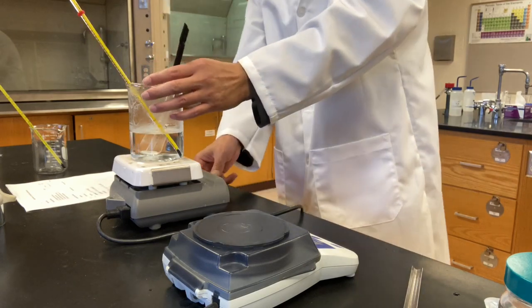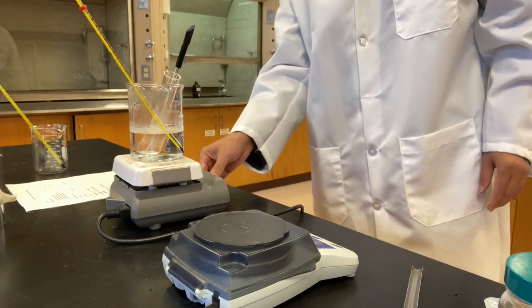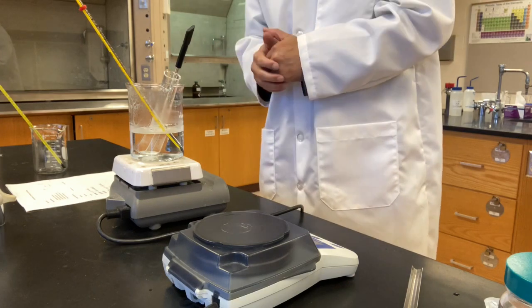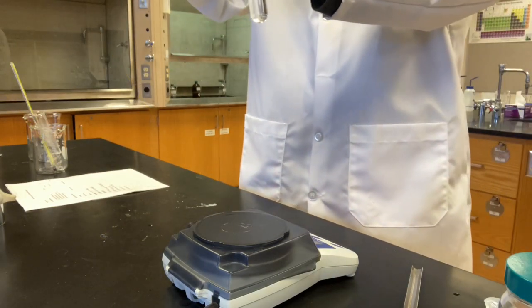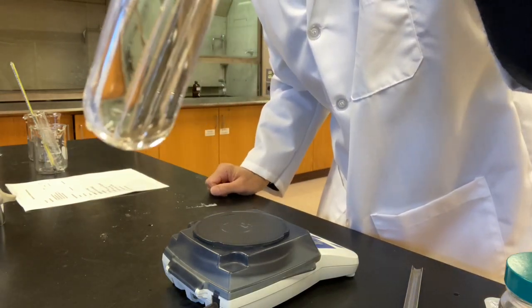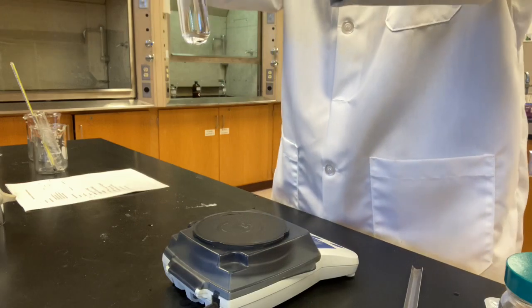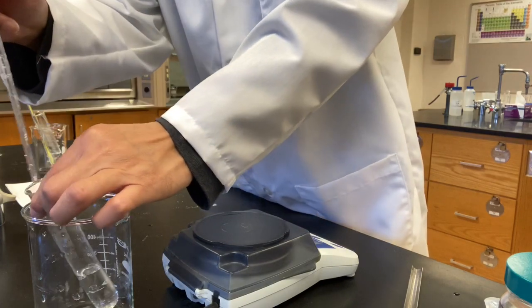Okay, I'm going to increase the heating. Make the water bath at higher temperature, but do not let it exceed 60 degrees Celsius. When temperature is too high, it's hard for you to cool it down later on. Now all the potassium nitrate has been dissolved. They're all gone. I actually have removed the heating setup. Okay, I'm going to leave it here to let it cool down.